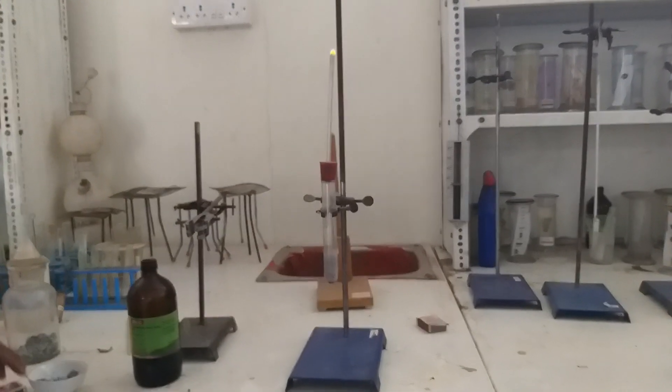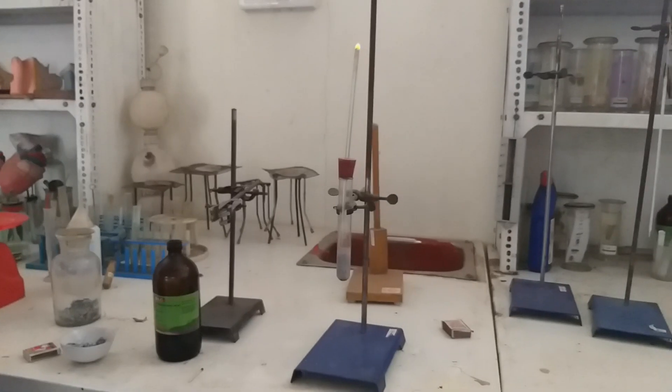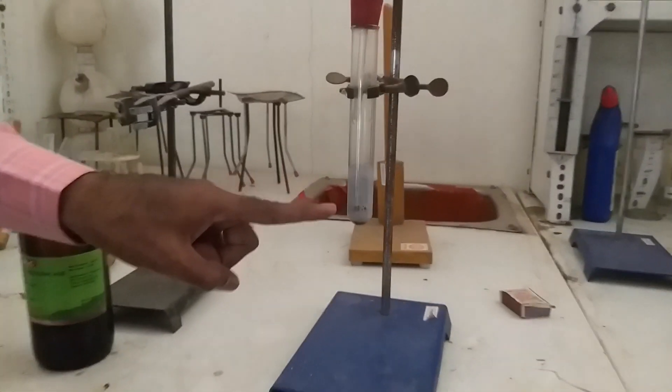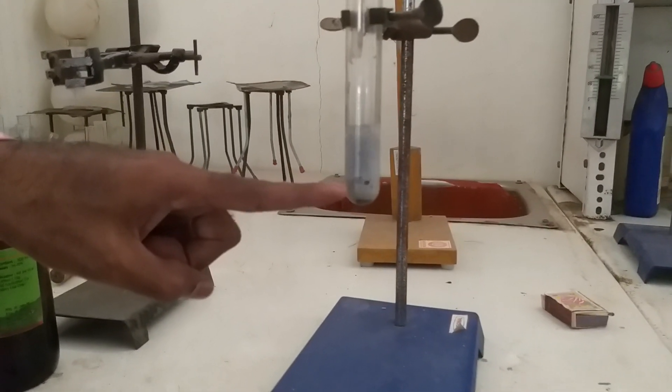Yes, this is burning hydrogen gas which also creates a puff sound. So this is the reaction taking place between zinc and HCl.